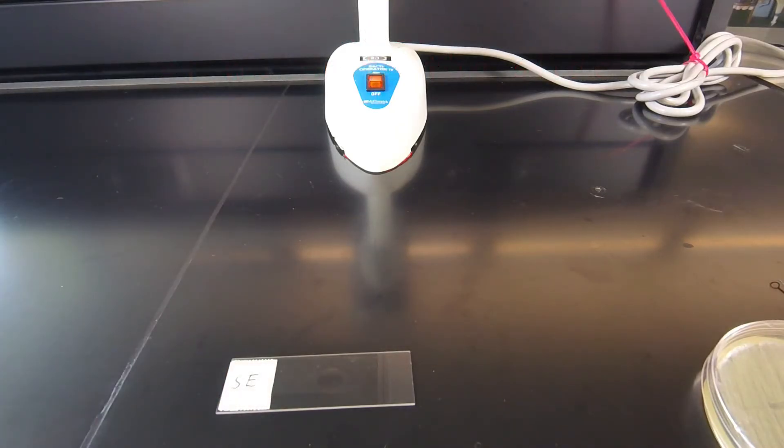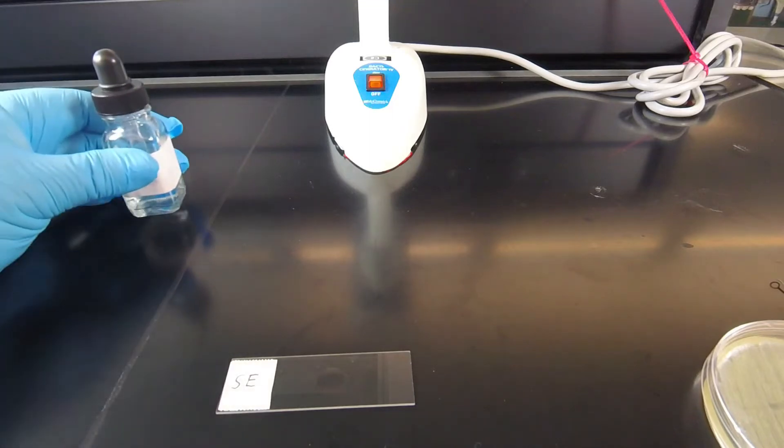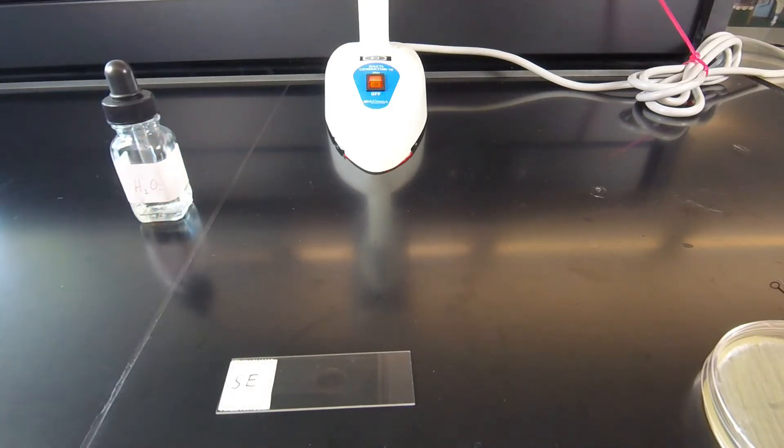Now the reason we don't want a lot of water is that this eventually has to air dry. The more water on the slide the longer it's going to take to air dry. So something like this should air dry in just several minutes. A lot of water could take 15 to 20 minutes to air dry.